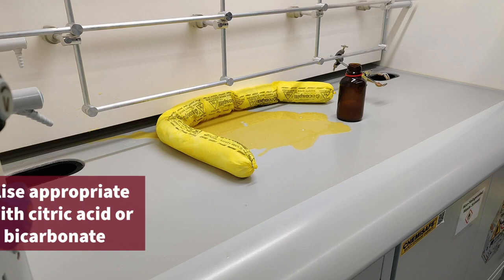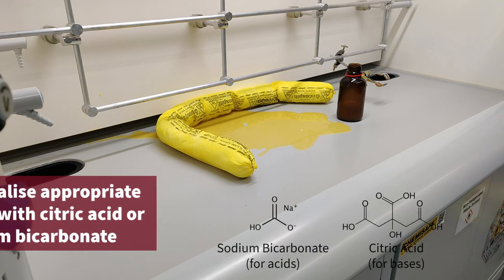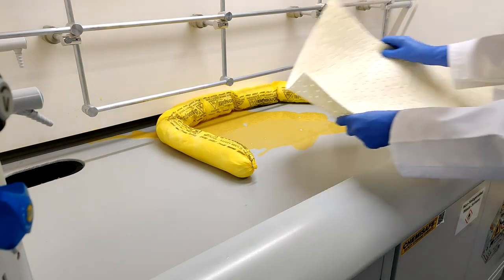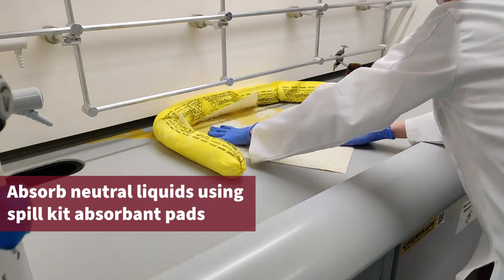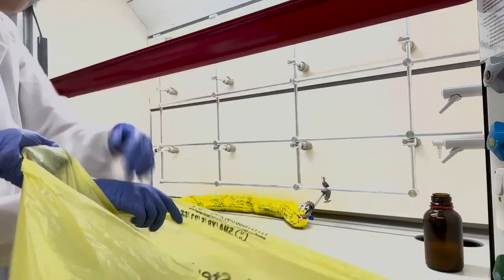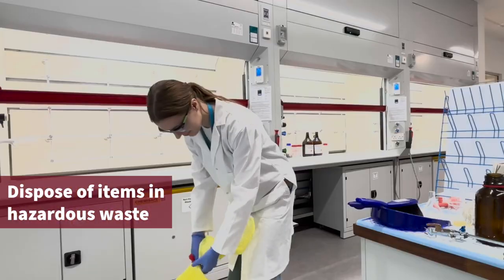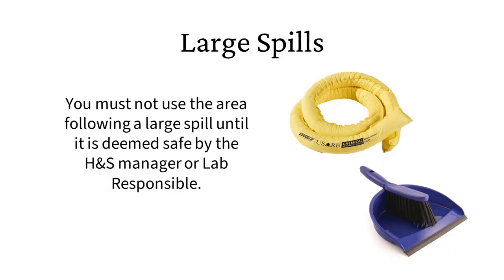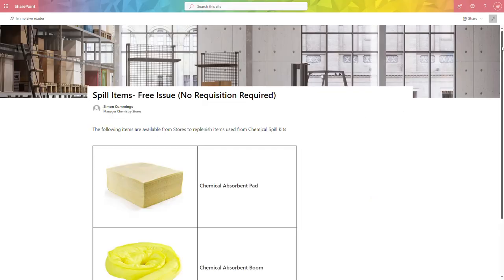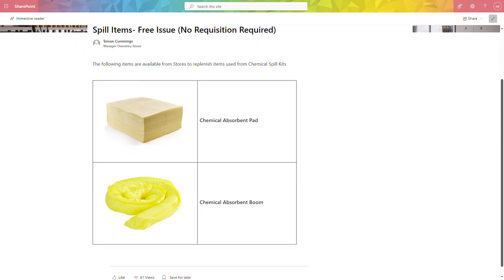Now, the liquid should be neutralized if appropriate using sodium bicarbonate or citric acid. pH paper can be used to determine when the spill is neutral. Once neutral, the liquid can be absorbed using absorbent pads from the spill kit. These should be disposed of with the spill socks and the yellow hazardous waste bags. Once the spill is clear, the hazardous waste bag should be taken to chemistry stores for disposal. The area should not be used until deemed safe by the lab responsible or health and safety manager. Remember to replace used items from the spill kit. These are available from chemistry stores.